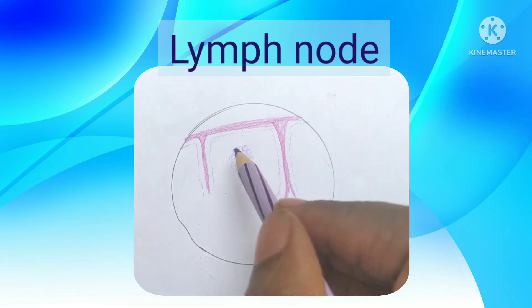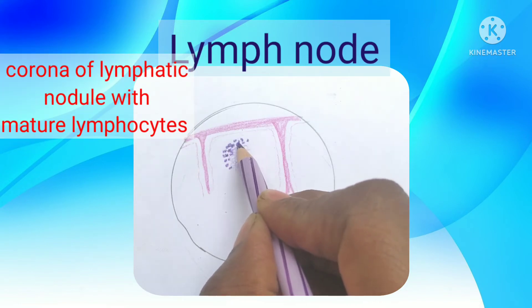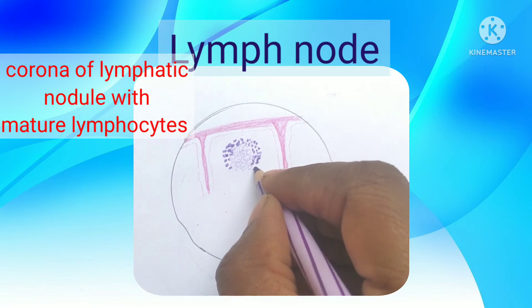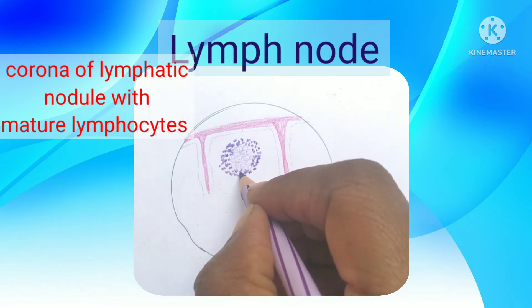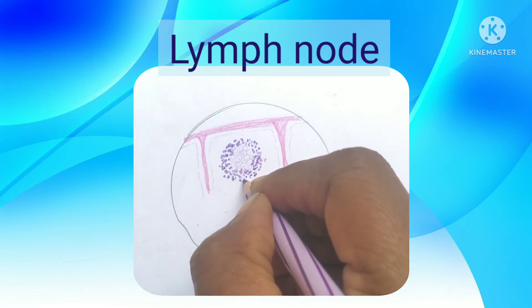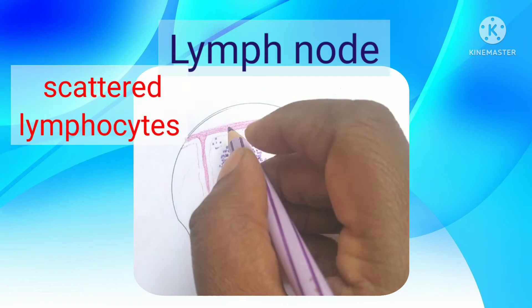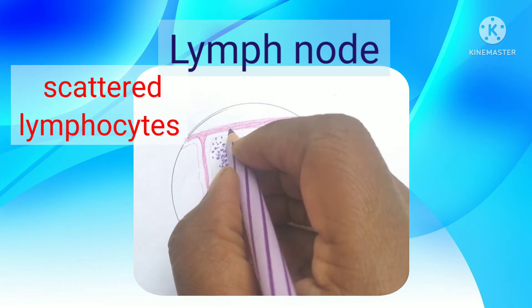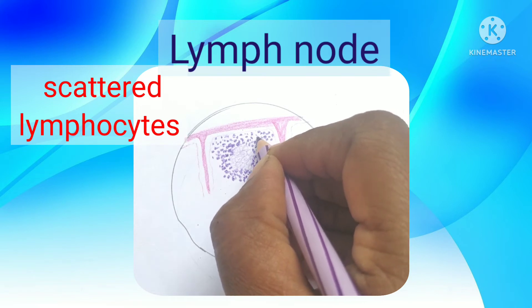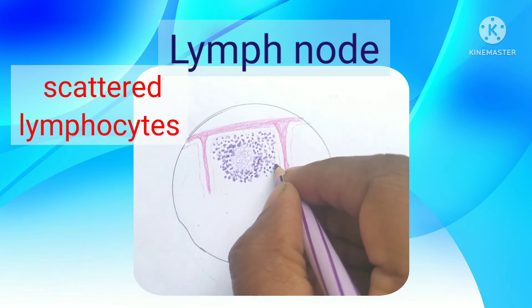The lymph node is divided into cortex and medulla. The cortex is divided into superficial cortex, which contains lymphatic nodules. These can be primary lymphatic nodules - just an aggregation of lymphocytes - or secondary lymphatic nodules, which contain a germinal center. The germinal center is lightly stained because it contains lymphoblasts - the blast cells with lightly stained nuclei - as well as plasmablasts.